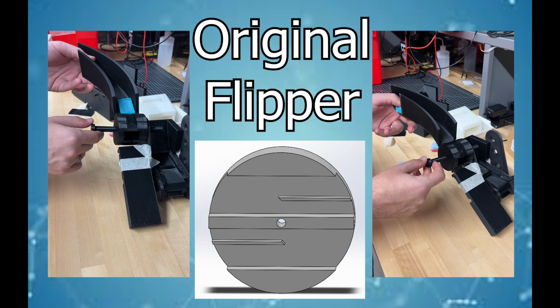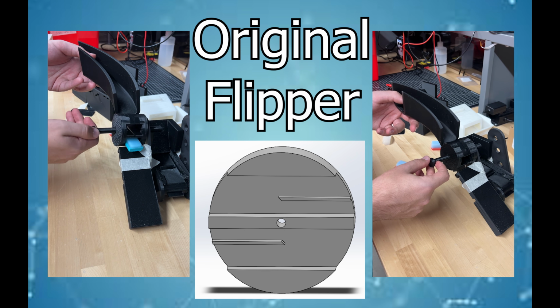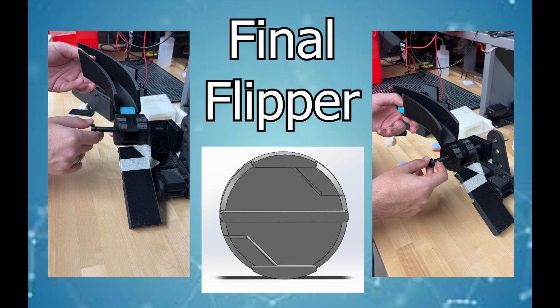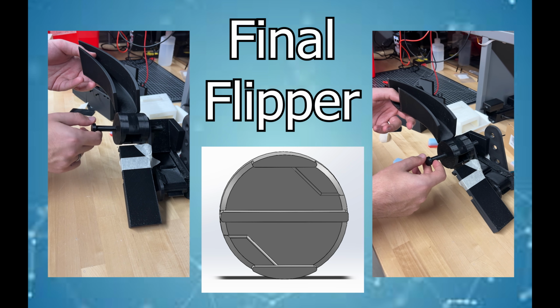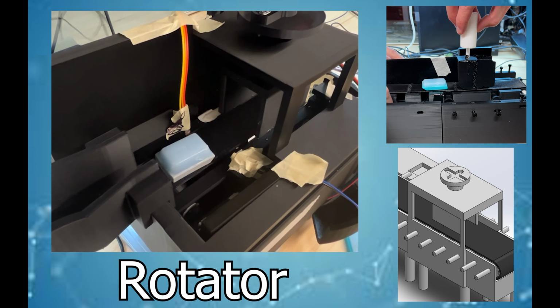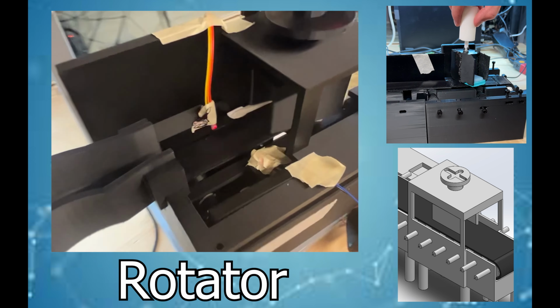Our first flipper design had a sharp bumper and didn't accommodate all wax block sizes. So our final version included lifting the ceiling wall as well as flushing the bumper to the ceiling. We also rounded off all edges to ensure safe user handling as well as minimize damage to the paraffin wax of the block.